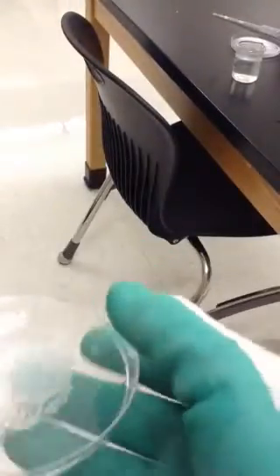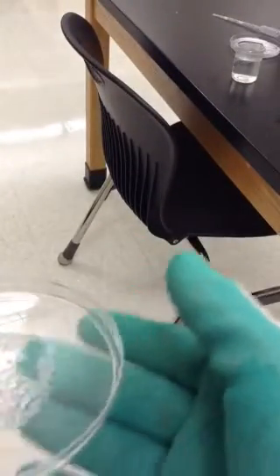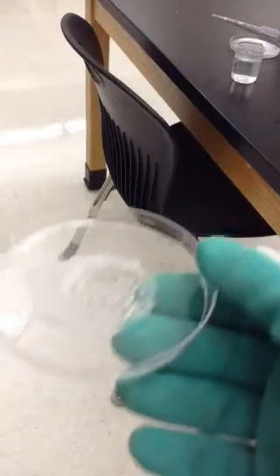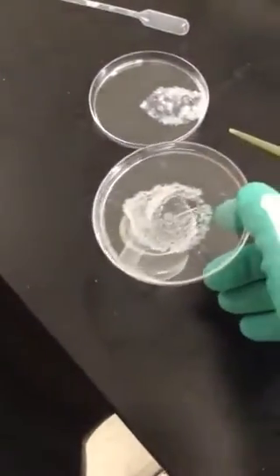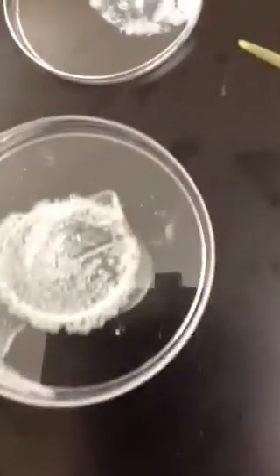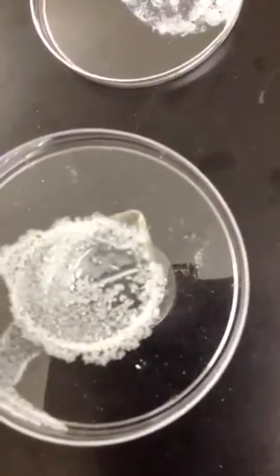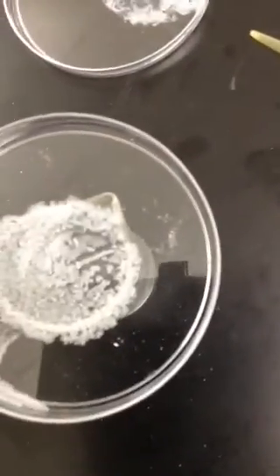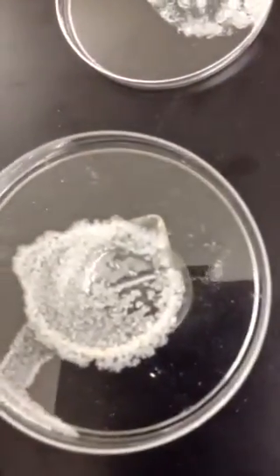We remove the condensation, all that water. You can see that it's finally, we can actually start seeing those crystals forming. We just had to remove the condensation because that makes it really hard to see. But it looks almost more glass-like, right, in its formation.